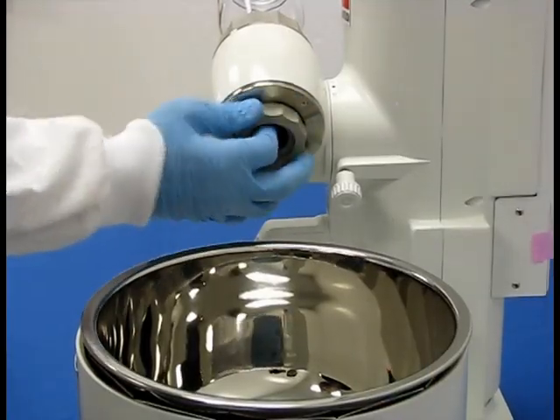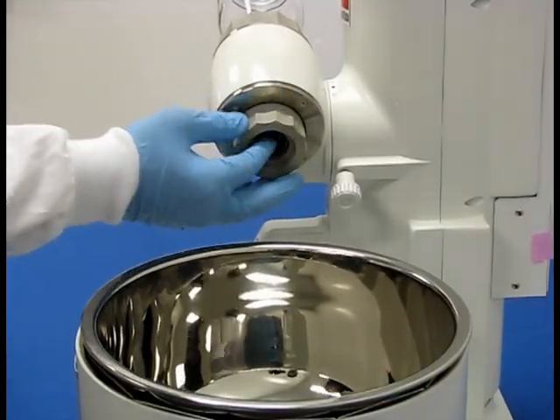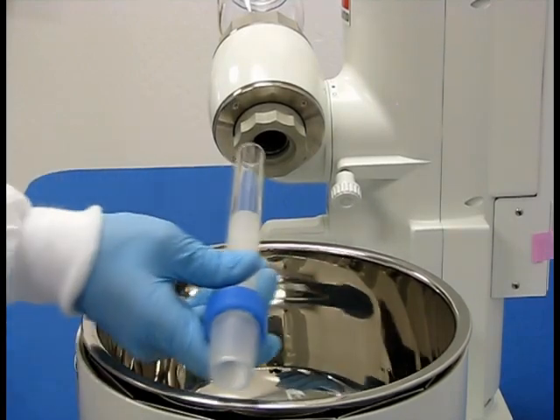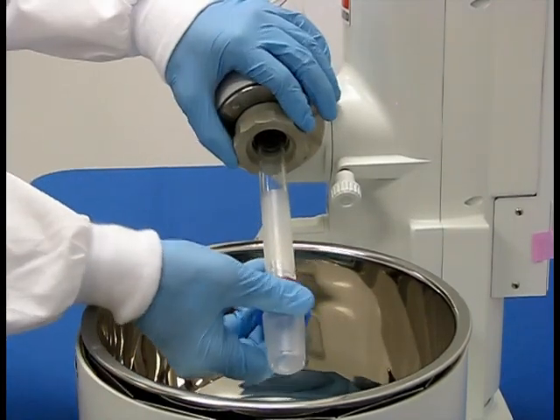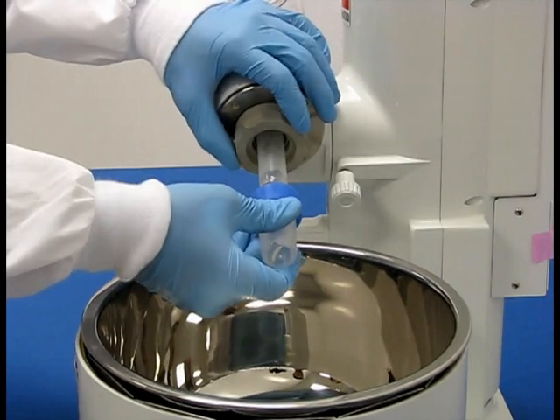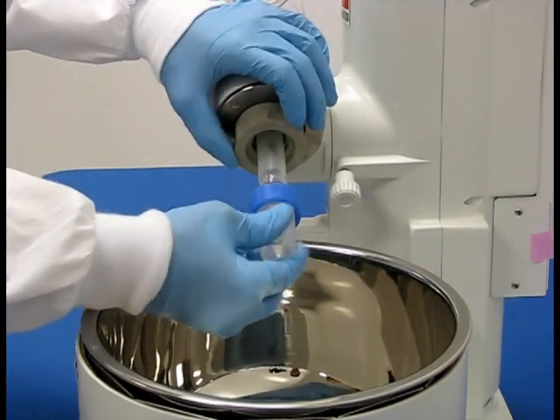Unfasten the rotary joint retainer and carefully insert the 29x42 rotary joint inside. Secure the rotary joint by fastening the retainer.